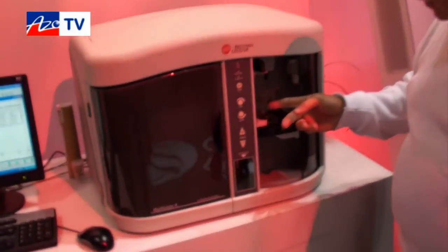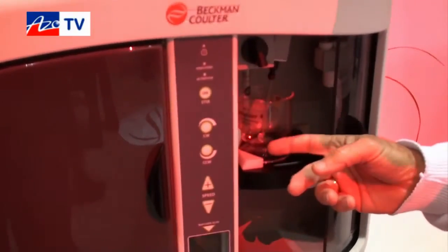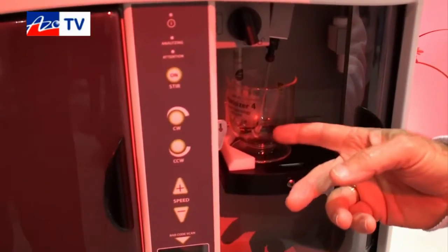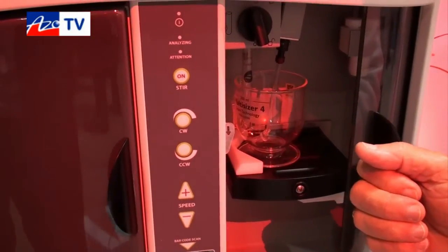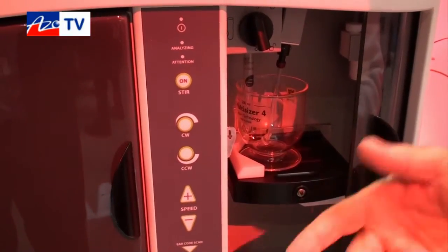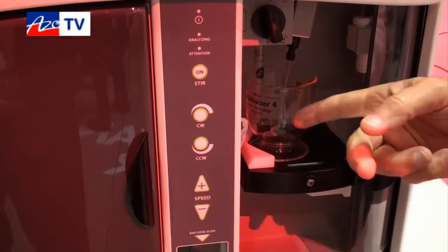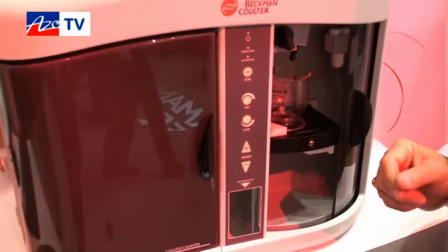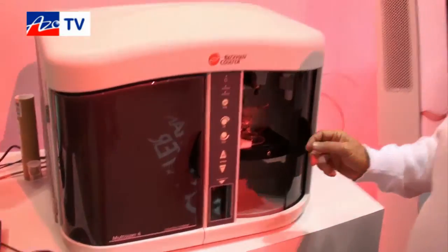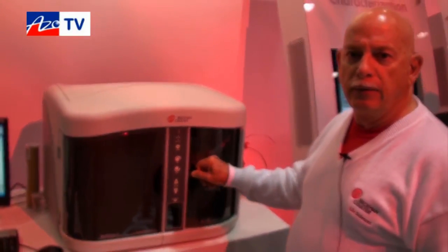The Multisizer has a sampling area where the particles are suspended in a beaker. They're kept stirred by a stirring motor to keep the particles suspended and homogeneous. Samples are controlled by a computer interface to actually aspirate the sample and collect the data.